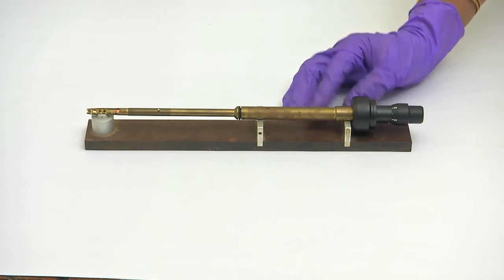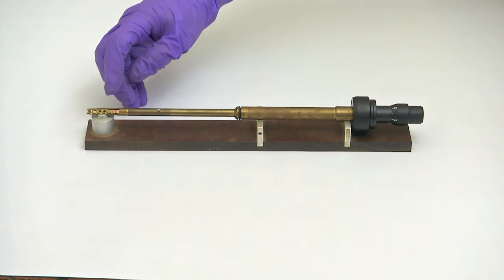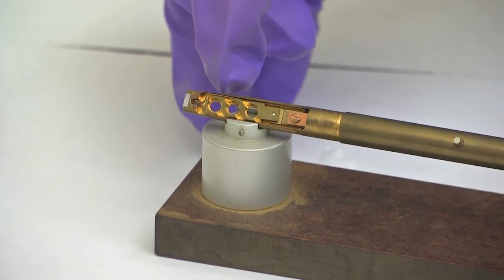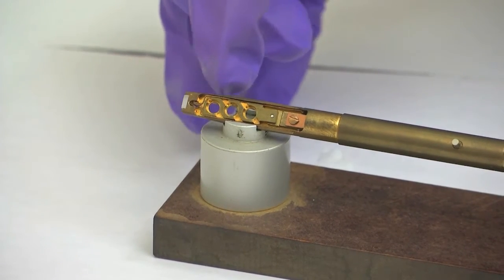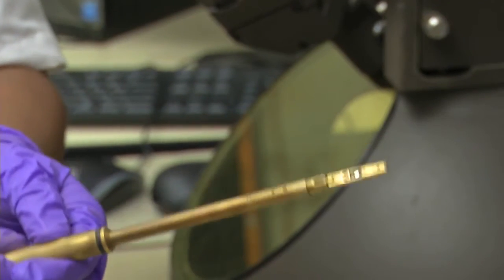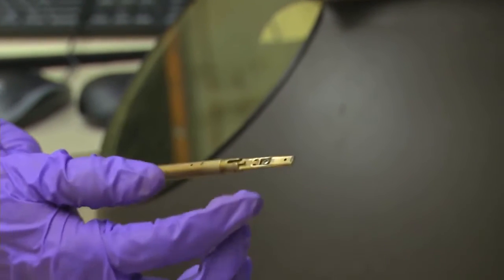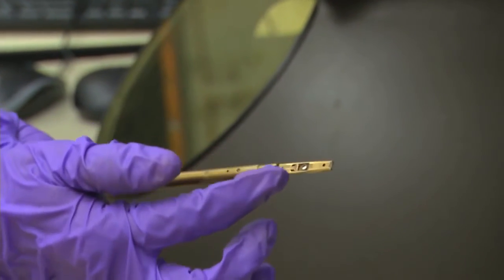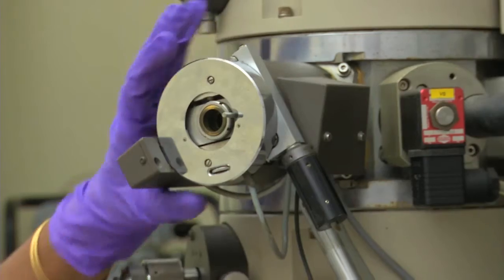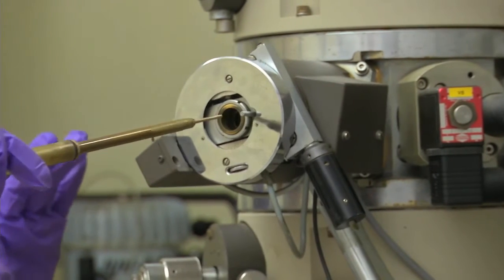This is a multiple specimen holder. By using this holder you can load 3 specimens together and view them one by one. This is a single tilt holder in which I have loaded an aluminium foil — you can see the specimen here. The goniometer is there, and I am going to insert this specimen.